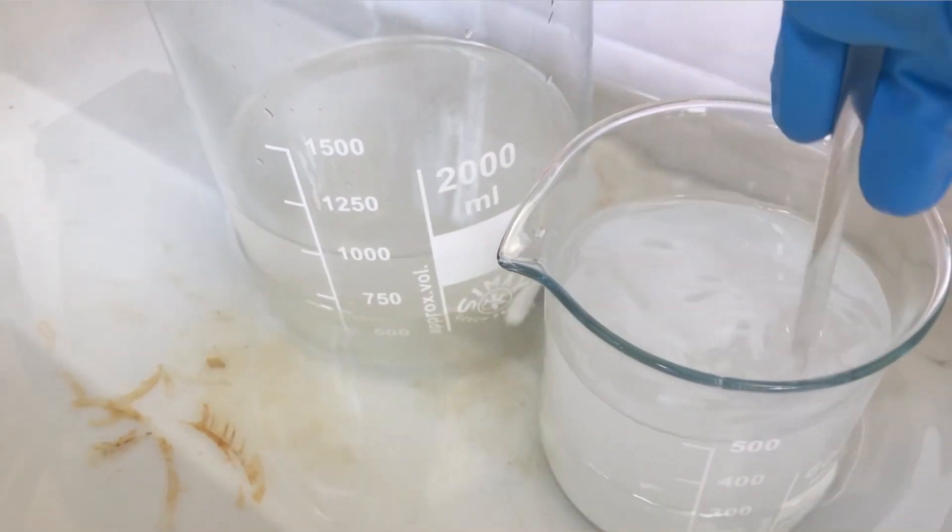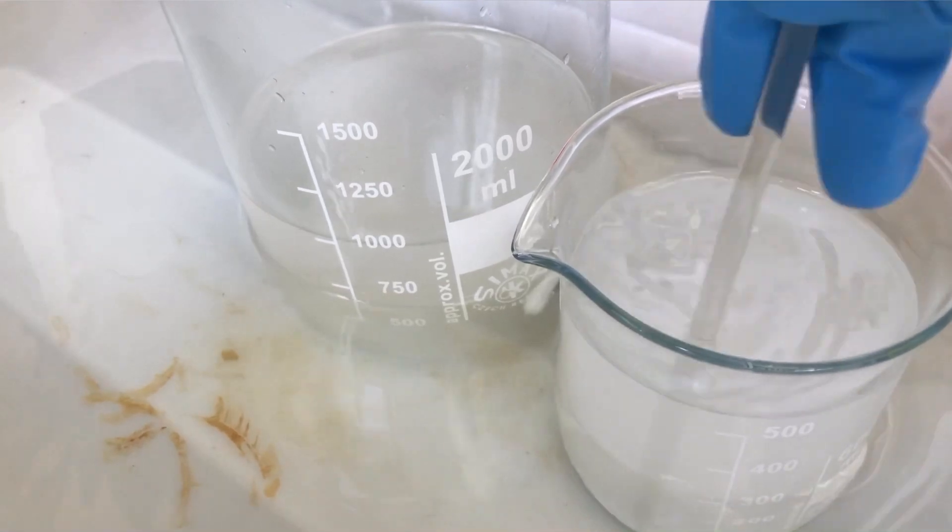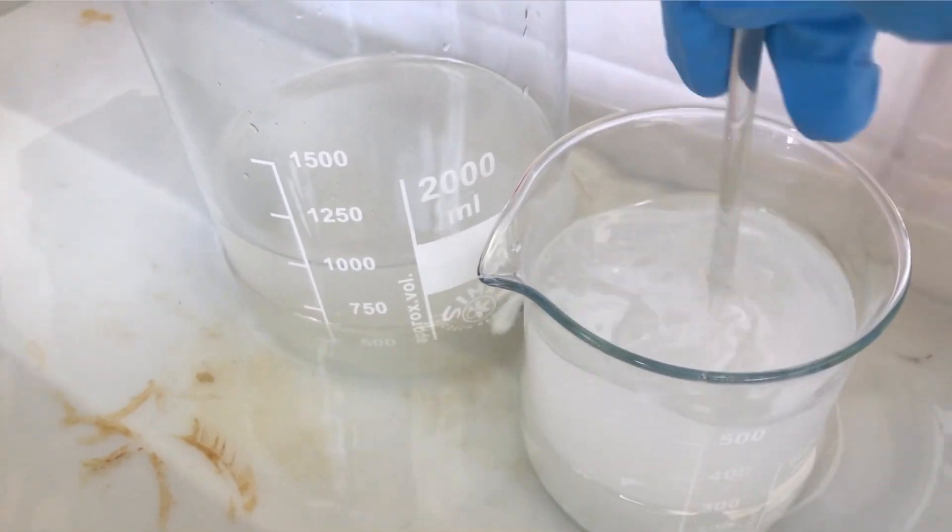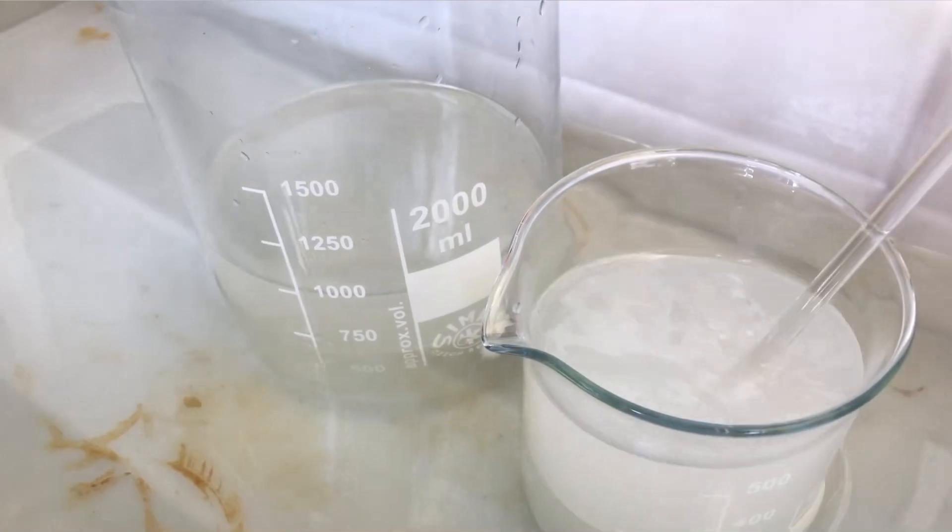I also put the sodium hydroxide solution into a water bath because it's extremely hot and we don't want to decompose too much hydrogen peroxide.